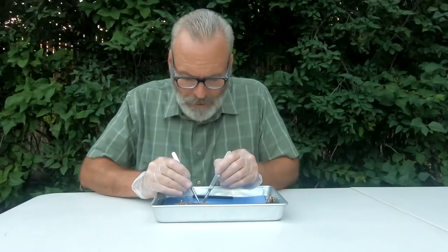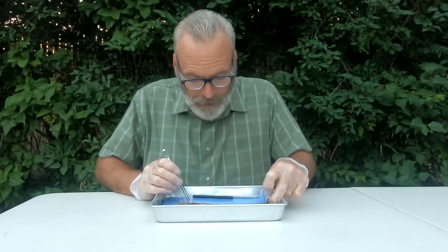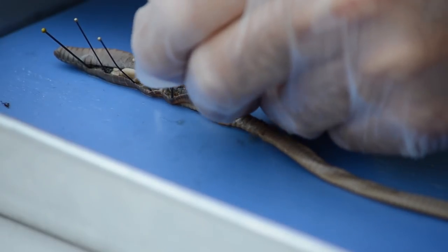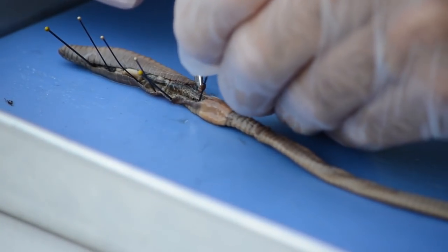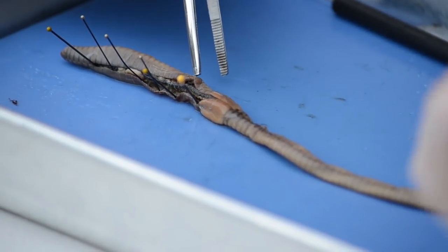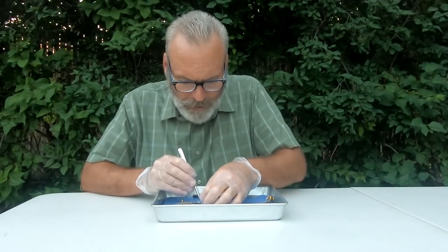Now the digestive tract runs all the way through from anterior to posterior — a super long intestine. It eats its way through the soil and loves to graze out on the top of the soil. I hit that just a little bit, but not too bad though.